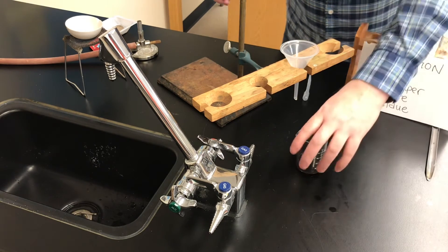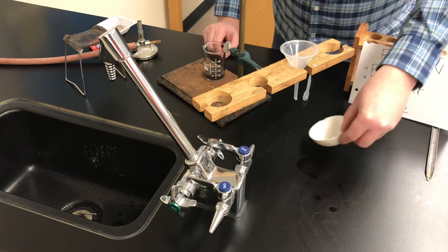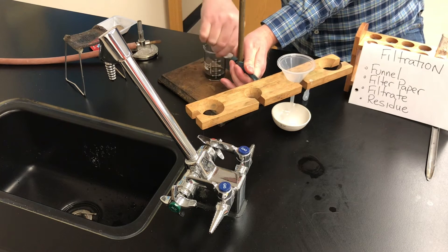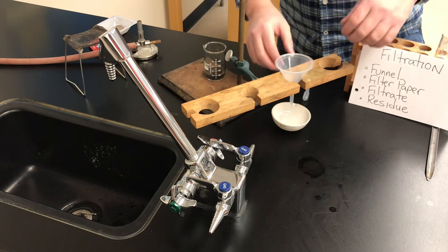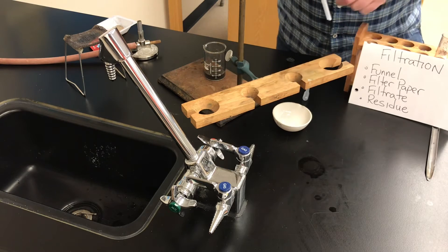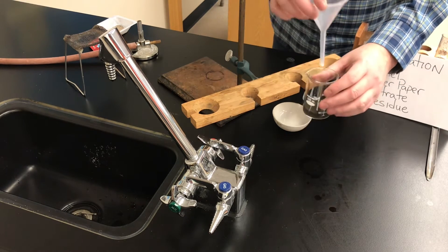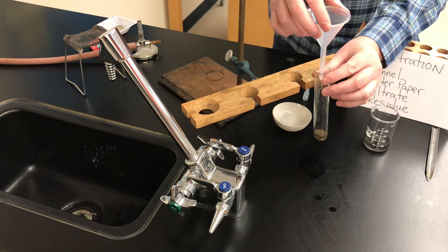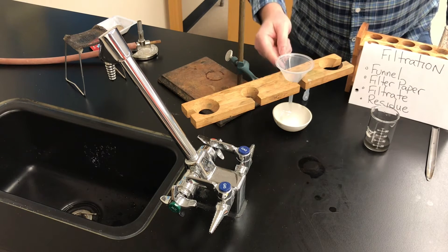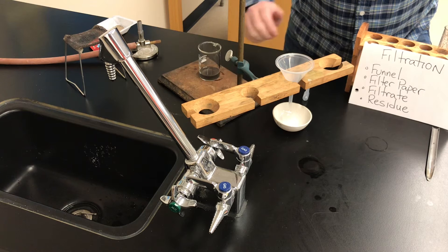That beveled hole is going to hold the funnel, so I'm going to put a funnel in there. Then I need to put something underneath the funnel — you could put a test tube, a beaker, or a flask. I'm going to use an evaporating dish. I'll lower it a little bit so things don't drip and splash. The neck of the funnel should sit just inside the mouth of whatever you're collecting into. The liquid that goes through the funnel has a name — we call it the filtrate.